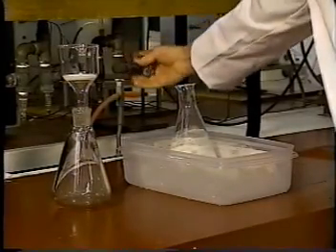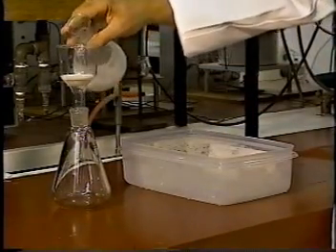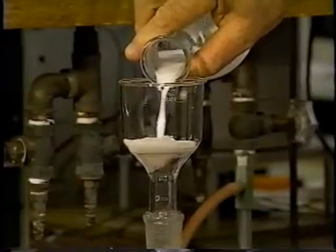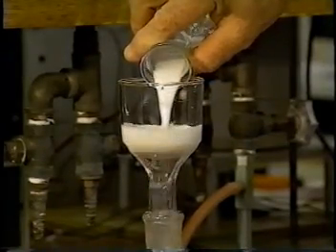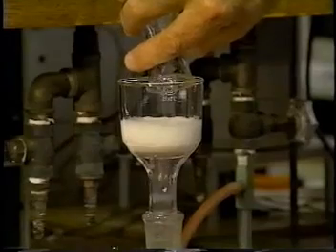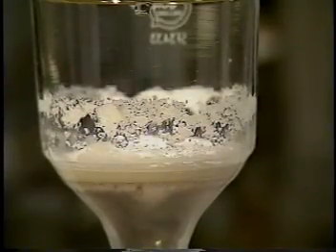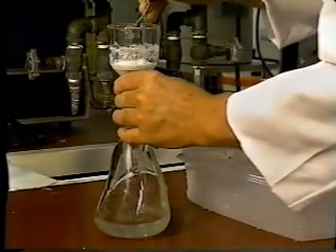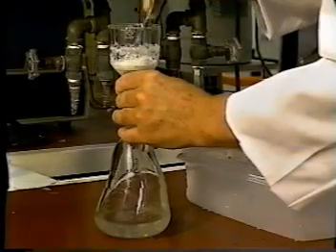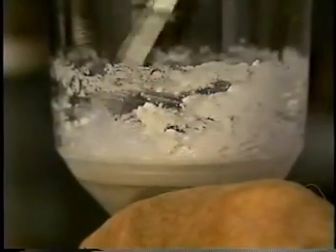We can do this using a vacuum filter. We just pour the mixture into the filter. This is a sintered glass filter funnel, where glass beads have been partly fused together to form a porous barrier. A vacuum pump draws the liquid through, while the solid remains behind. Finally, we scrape it to let the filter draw more air through, to make sure all the moisture has been removed.